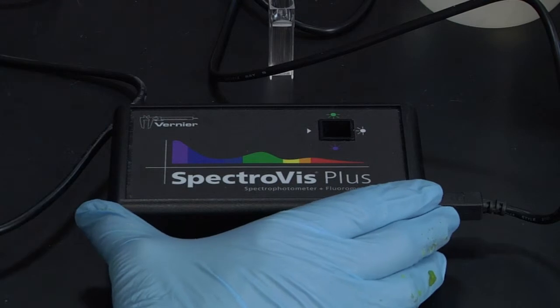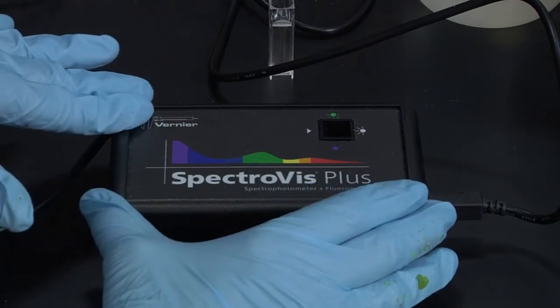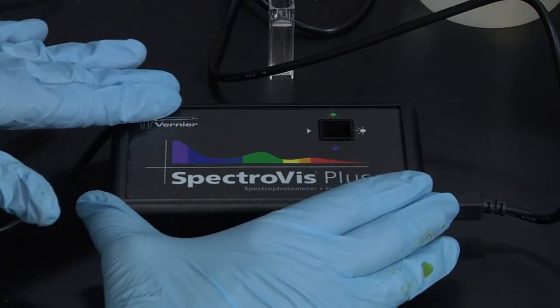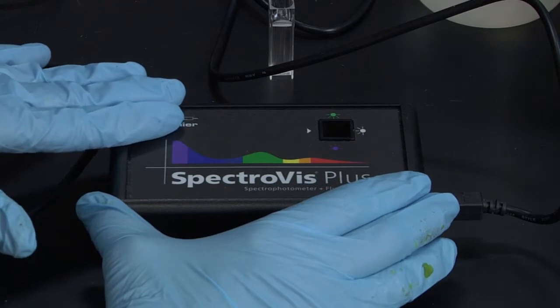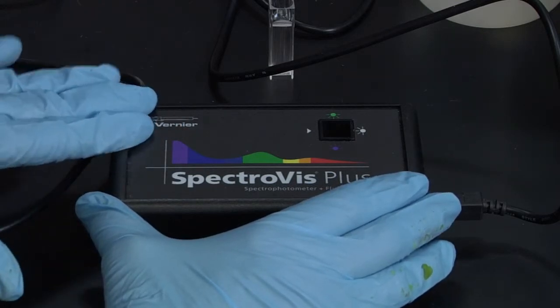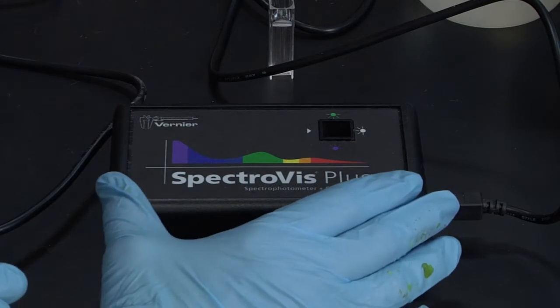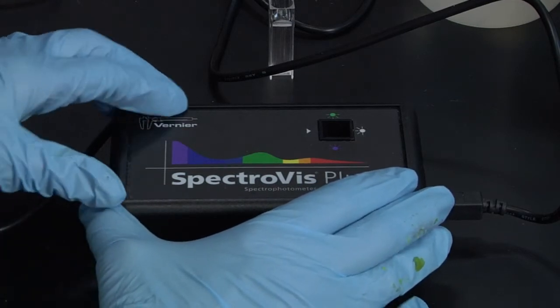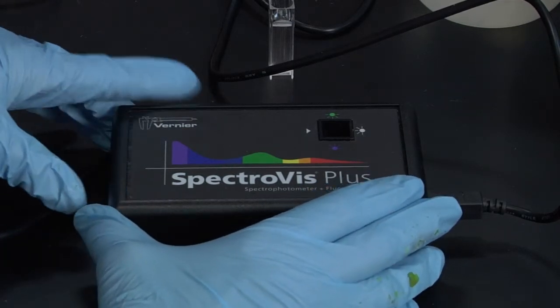What we have here is a spectrophotometer, and we're going to use it to quantitatively tell us something about the energy via the wavelength that is absorbed by a solution.